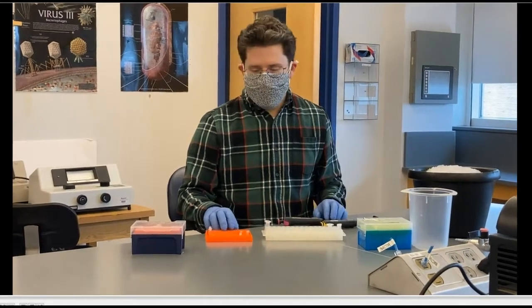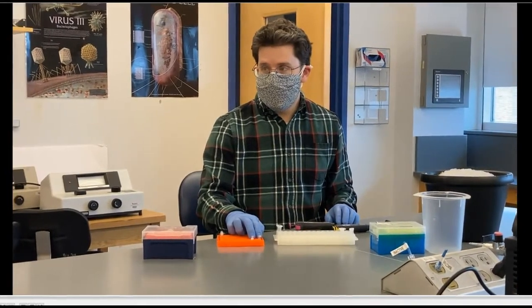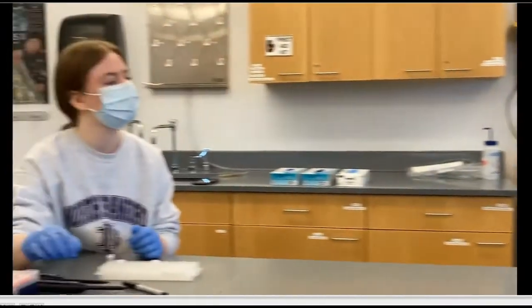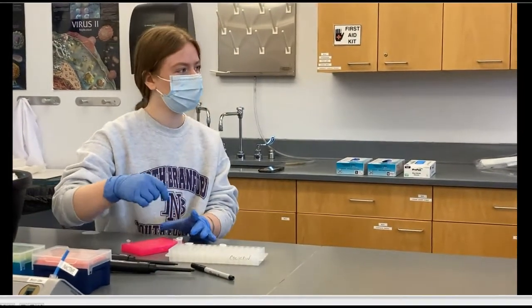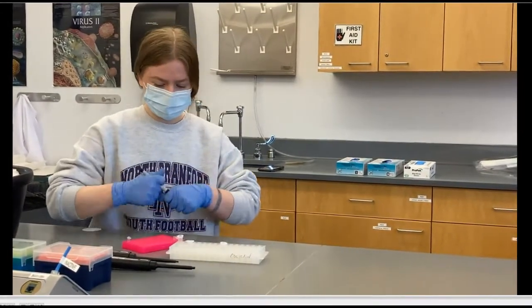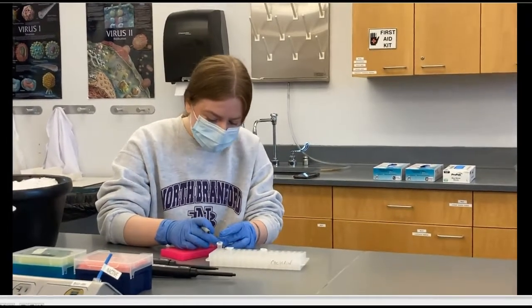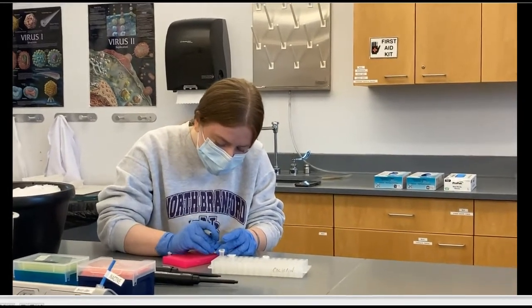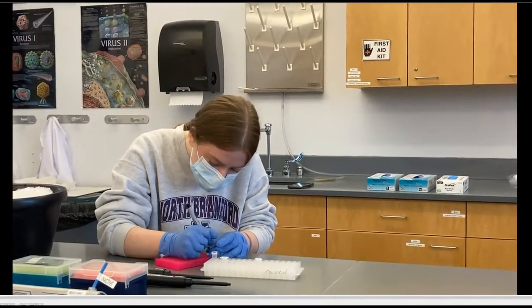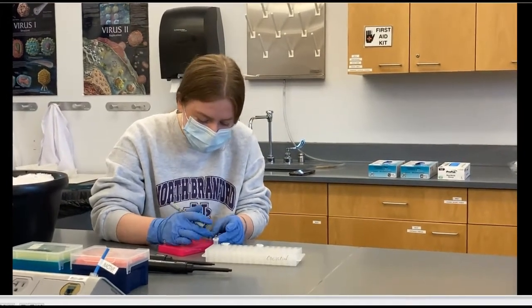So to begin with, take those two small tubes in the small rack and label one of them one and label the other two — just on the lid. Tube number one will be 1522R, and tube number two will be 907R. We just use one or two to limit the amount of writing on that really, really small tube.